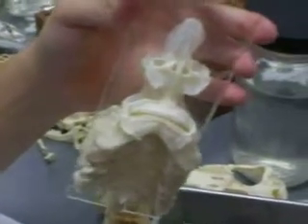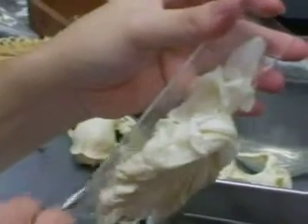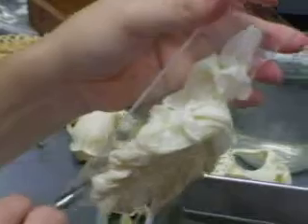Everything behind it — everything dorsal in this part here — is epibranchial. Everything ventral here is ceratobranchial.